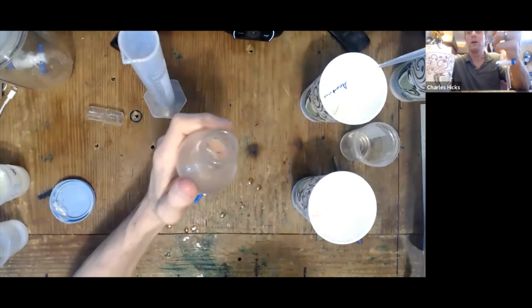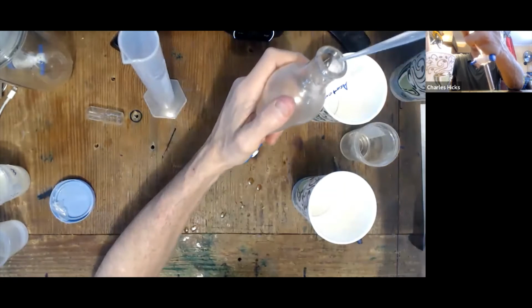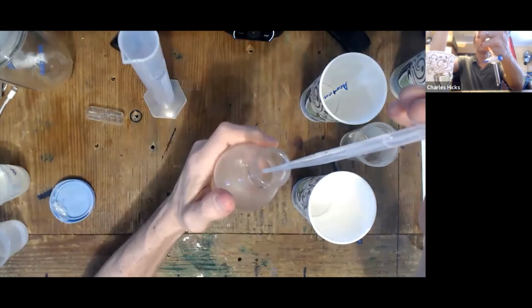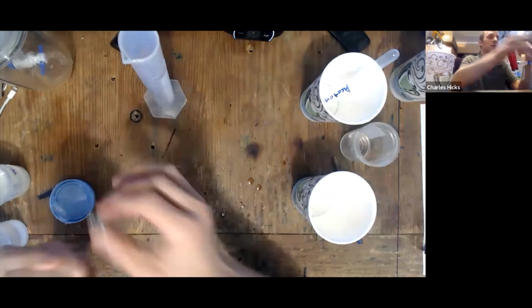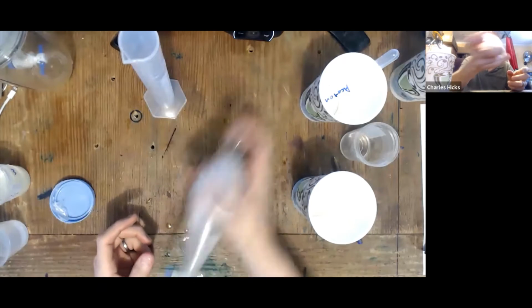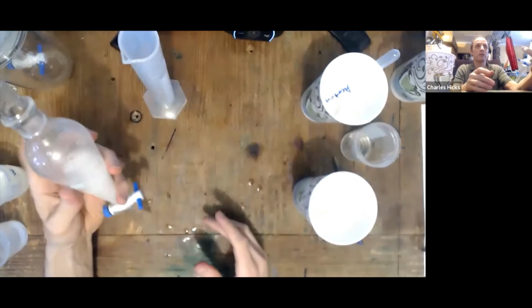And then put 15 drops of, I'm going to do this whole demonstration with acetone, but you guys will be doing triethyl citrate. So 1, 2, 3, 4, 5, 6, 7, 8, 9, 10, 11, 12, 13, 14, 15. 15 drops, 15 mLs, 15 mLs, and 15 drops. Put those three together in the separatory funnel. Give that a good shaking for several minutes. And this we're going to leave sitting to equilibrate until next week.